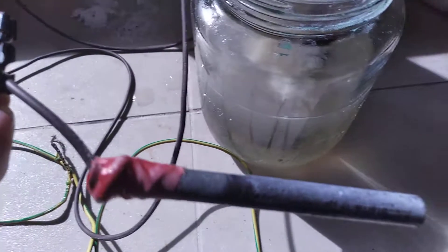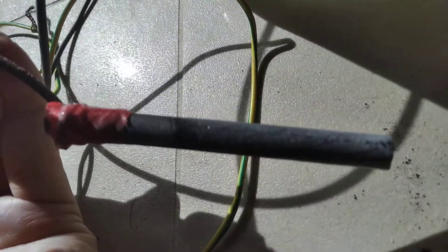Which is evident by looking at it, there's this nice white layer of calcium hydroxide as you can see. It's some sort of encrusting over here.